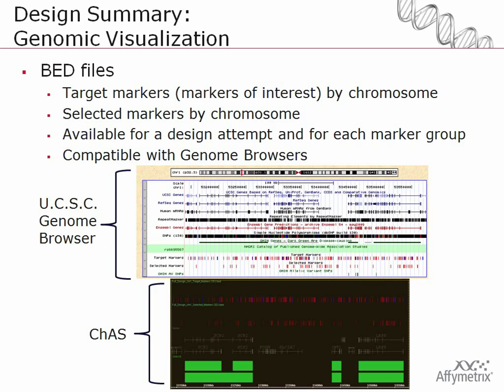So we provide the target markers, or those are the markers of interest, by chromosome. A second file is the selected markers by chromosome. And then they are available at both the design attempt level and for each marker group. And bed files, as you're probably aware, are compatible with the genome browsers. Shown here is loading the bed file into either the UCSC genome browser, where you can see the target markers and the selected markers, or loading the data into ChAS.